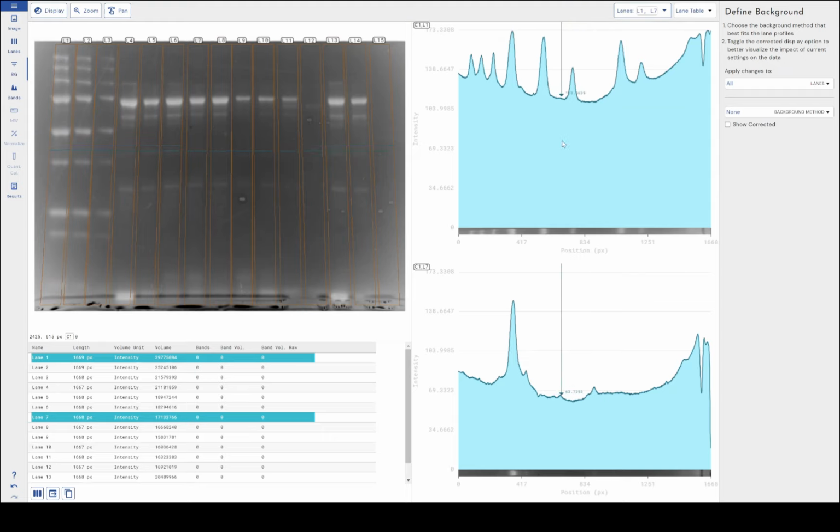And the way that Phoretix handles lanes when you've got multiple lane profiles selected is my cursor is at the same point on both these lanes. But you can see very clearly that the background over here is much different to the background in lane 1. It's very different to the background that's in lane 7. And this is going to be even further highlighted as I roll through the various different background correction options that I've got.